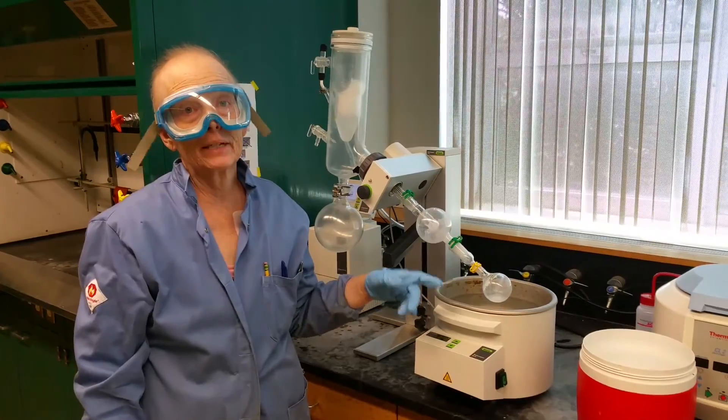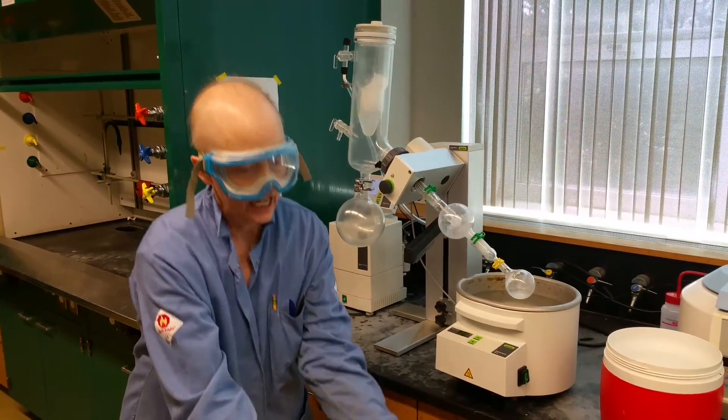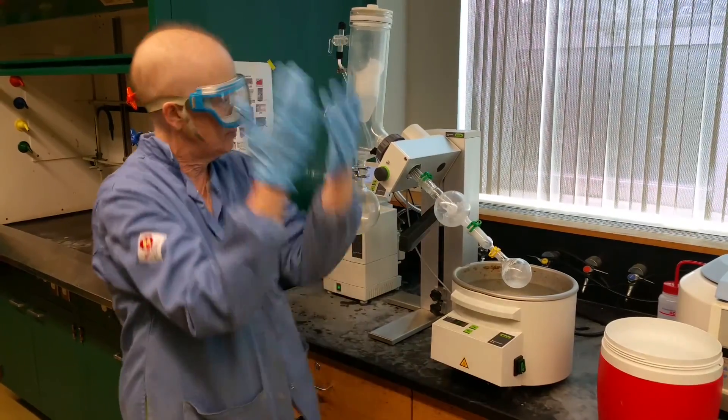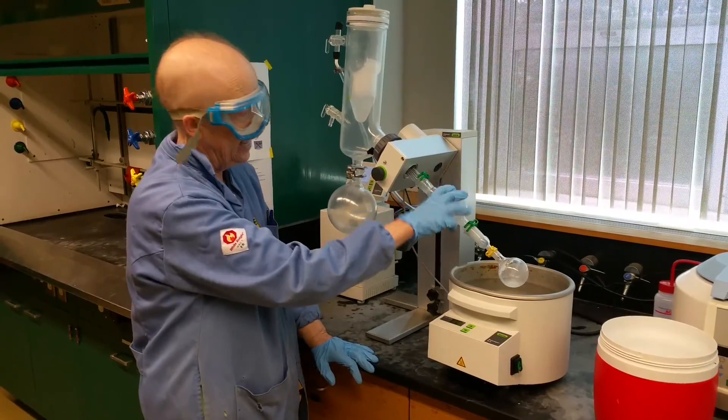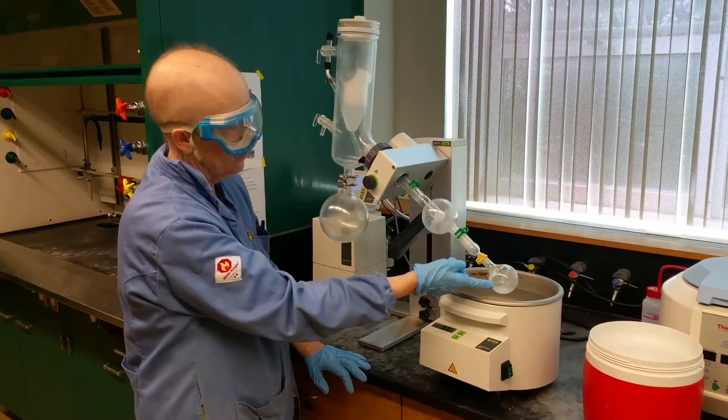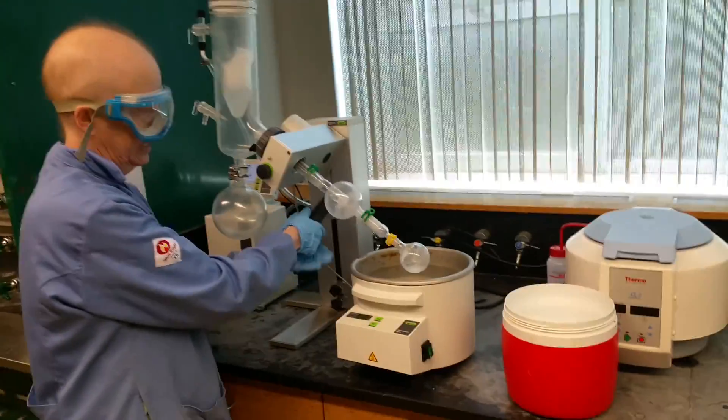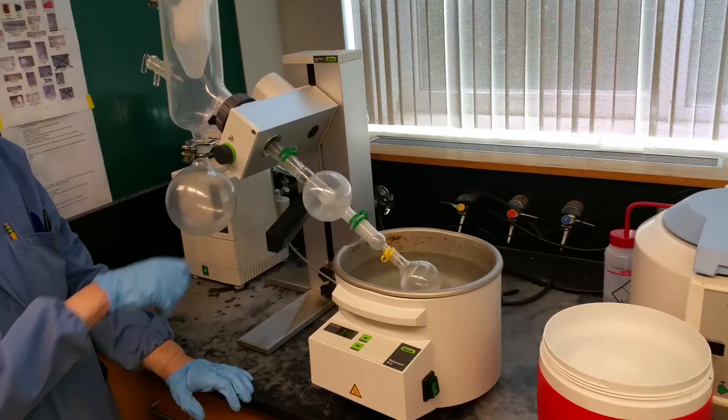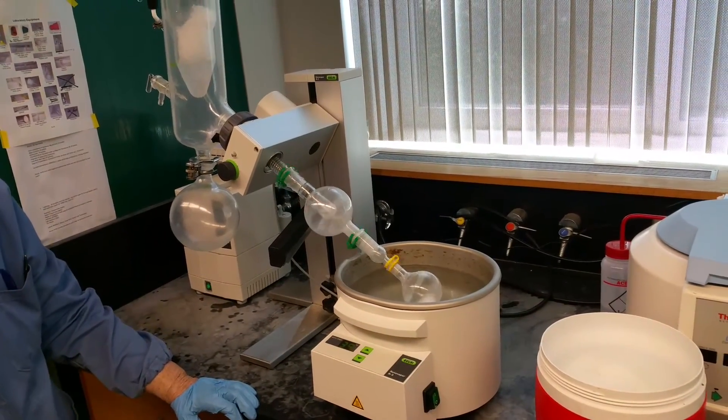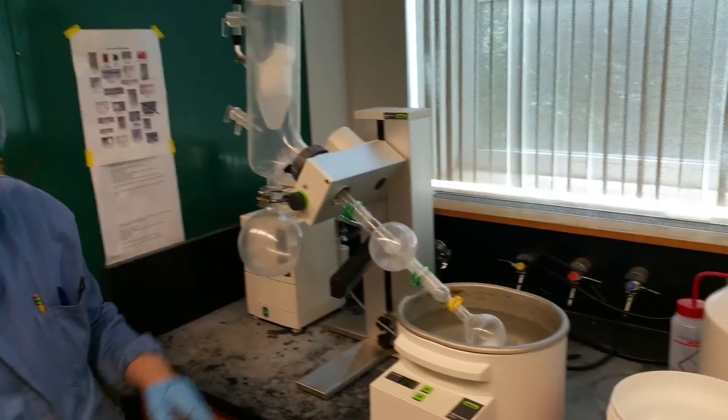And then they take it out and they just get a giant bubble coming in the bottom of their mug of coffee and it just goes flying all over the place. So that's one of the dangers of a microwave. That's what happened here. I just suddenly have a very smooth surface and a sudden huge bubble formation. All the liquid shot up in here, and a lot of the compound got trapped in here. But I have a trap. If I didn't have the trap, what would happen? It would just shoot over. But that's what the trap's for, and you saw it happen in the beginning.